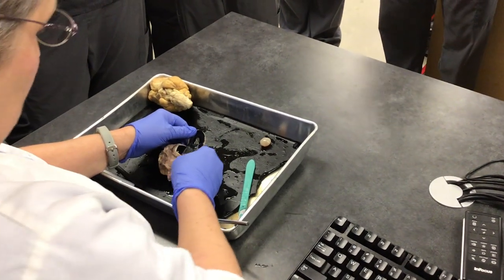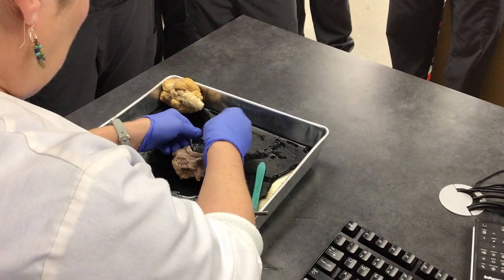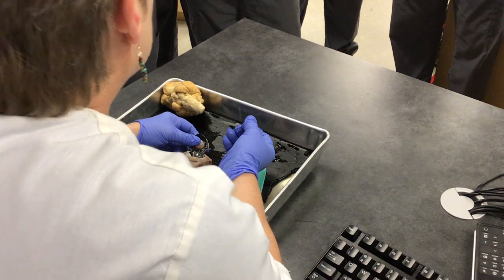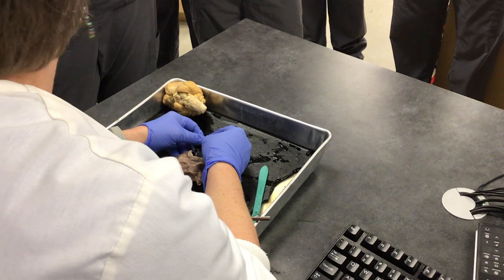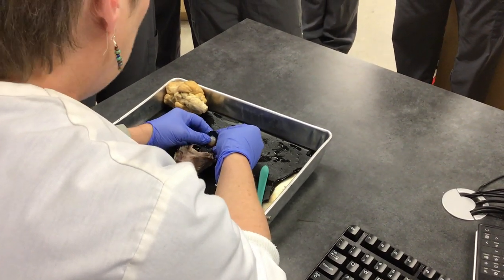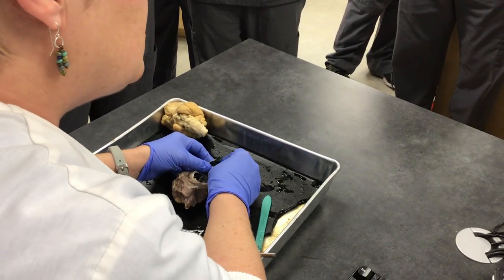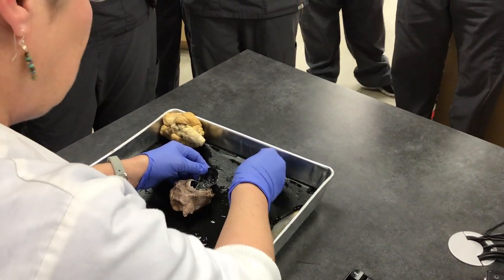I want you to know that in front of the lens, in the anterior part of the eye, we have what is called aqueous humor. It's basically water — it keeps the eye hydrated and it's very, very important, especially for the lens. So the aqueous humor is found in front of the lens.